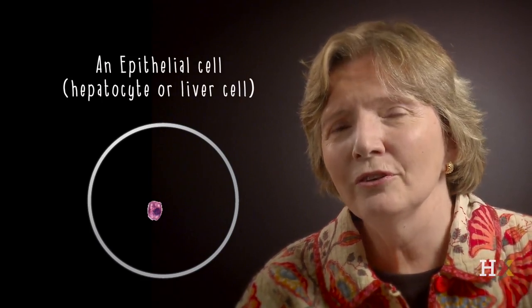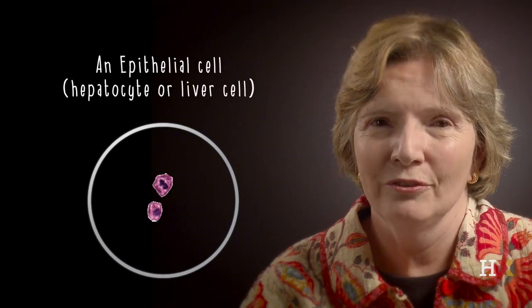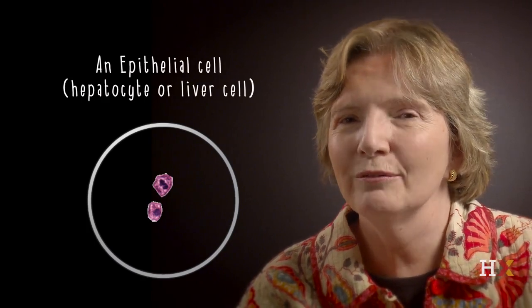And then just above the first cell, you can see a second cell, which is another liver cell, but this time with two nuclei. So that is a feature of liver cells. Not very many cells in the body have double nuclei.